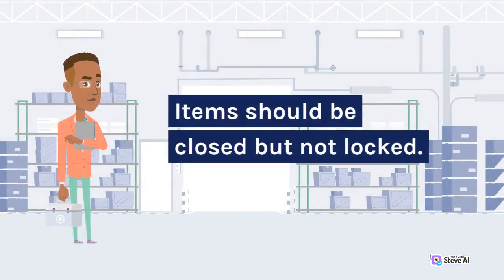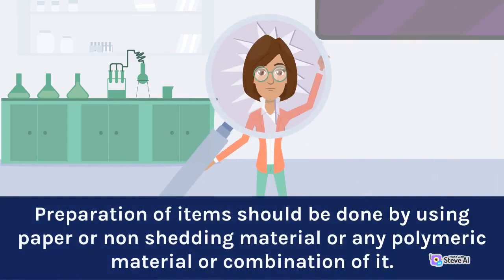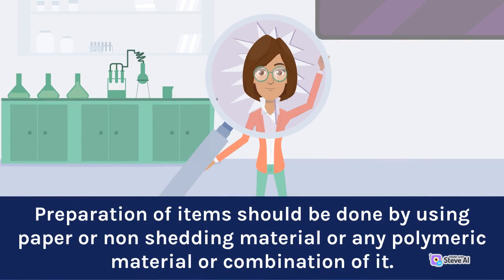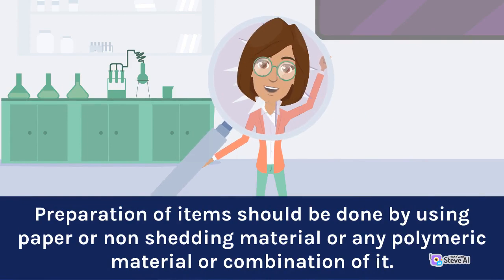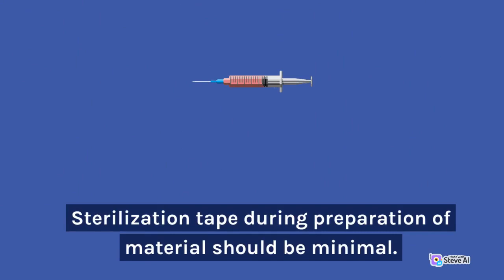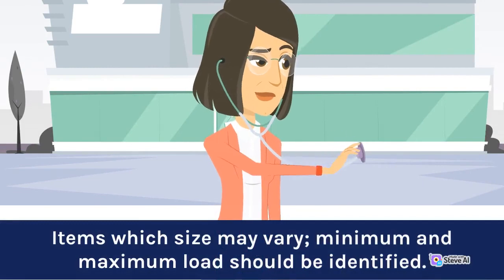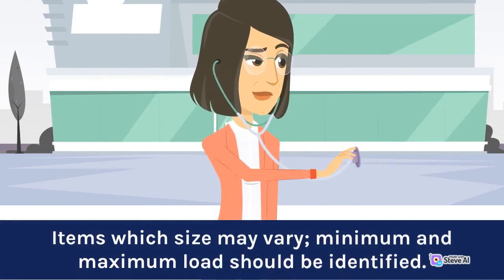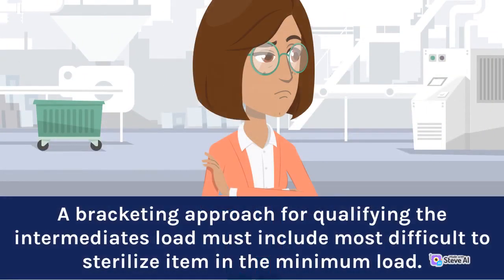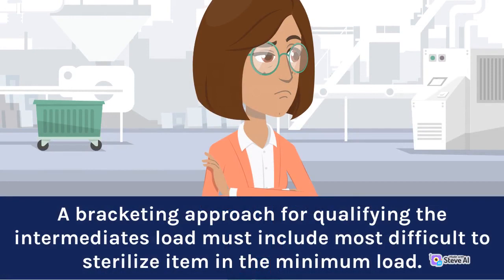Items should be closed but not locked. Preparation of items should be done using paper, non-shedding material, polymeric material, or a combination of these. Sterilization tape during preparation of material should be minimal. For items whose size may vary, minimum and maximum load should be identified. A bracketing approach for qualifying intermediate loads must include the most difficult to sterilize item in the minimum load.